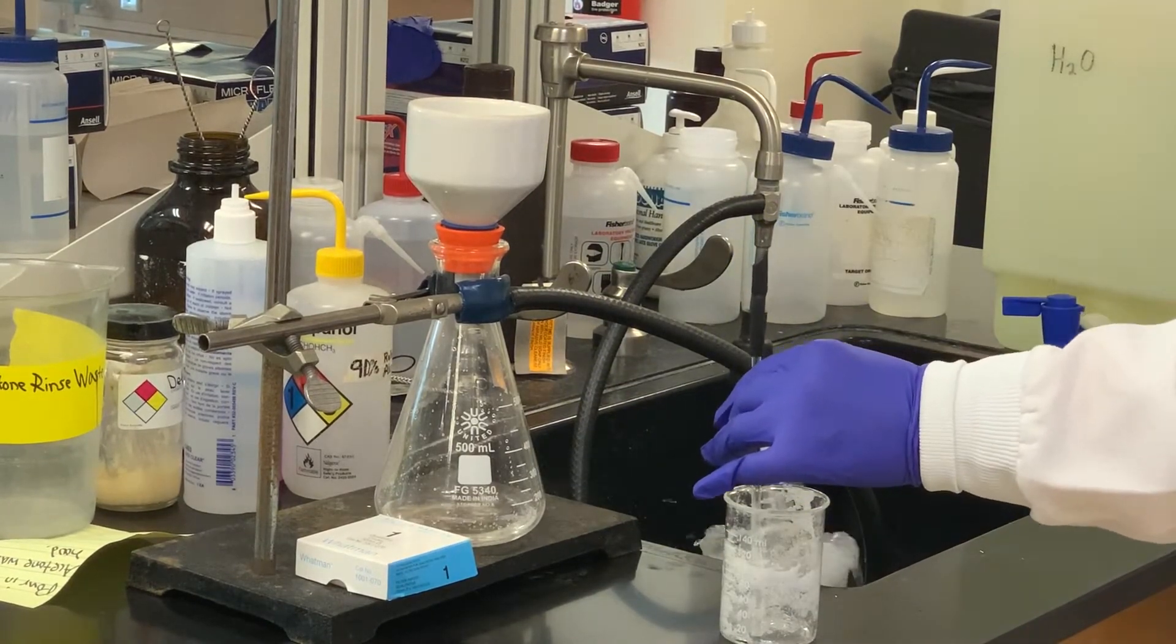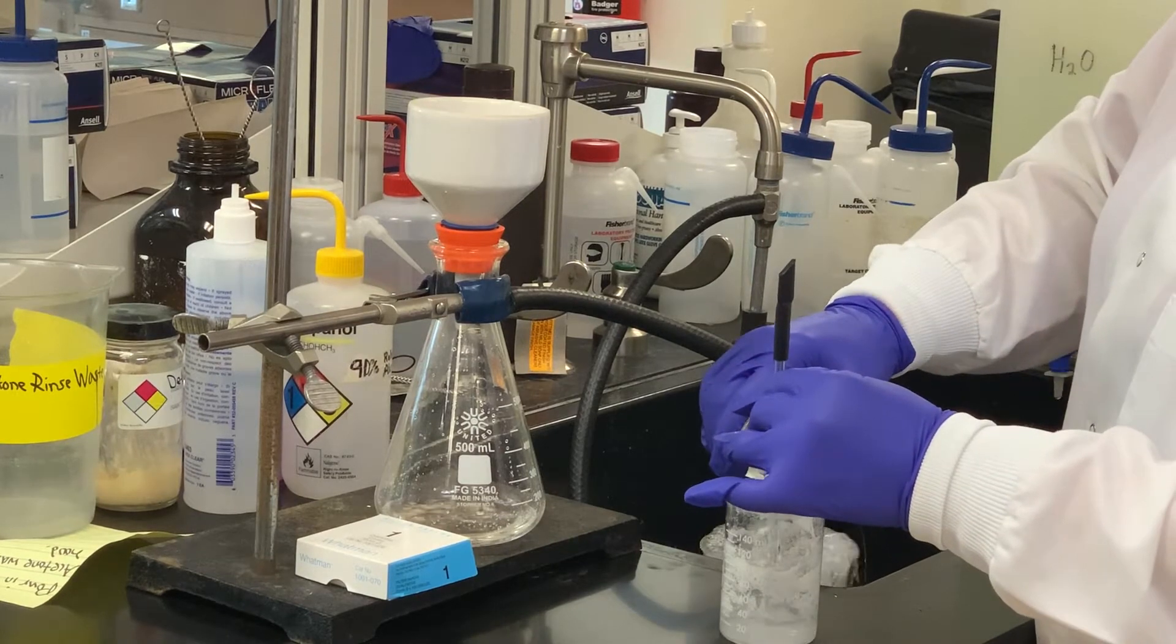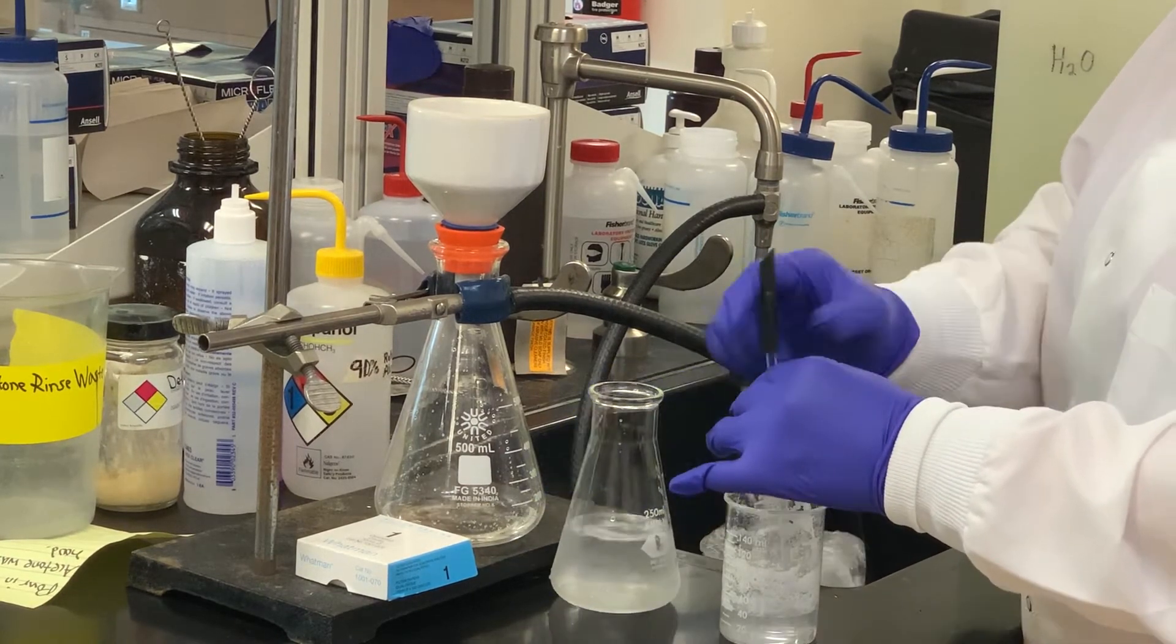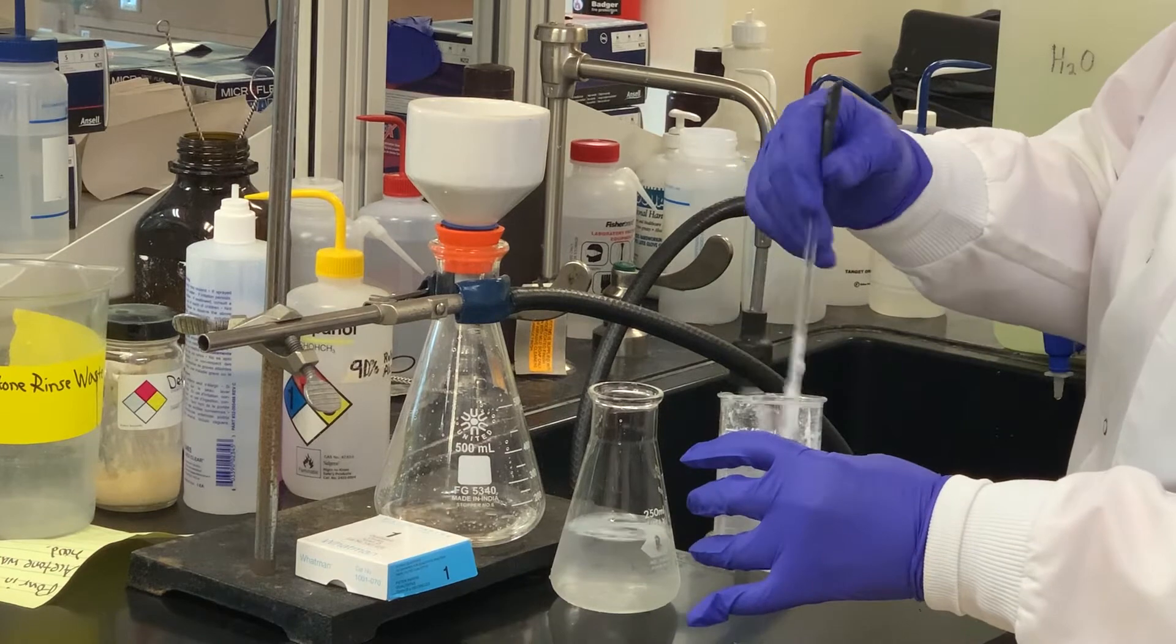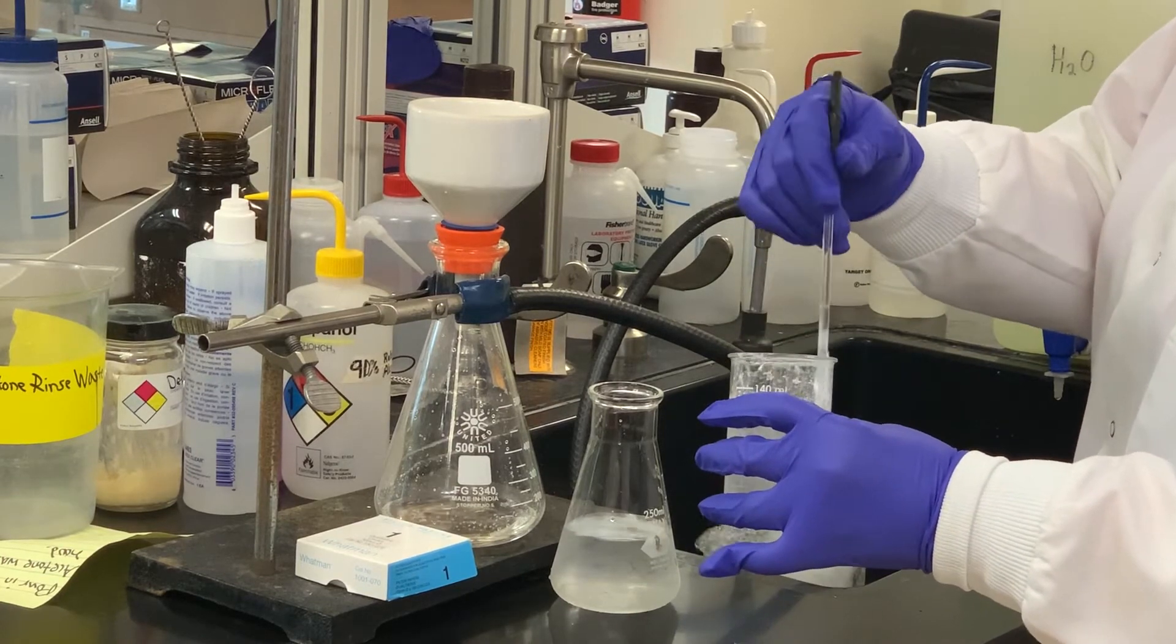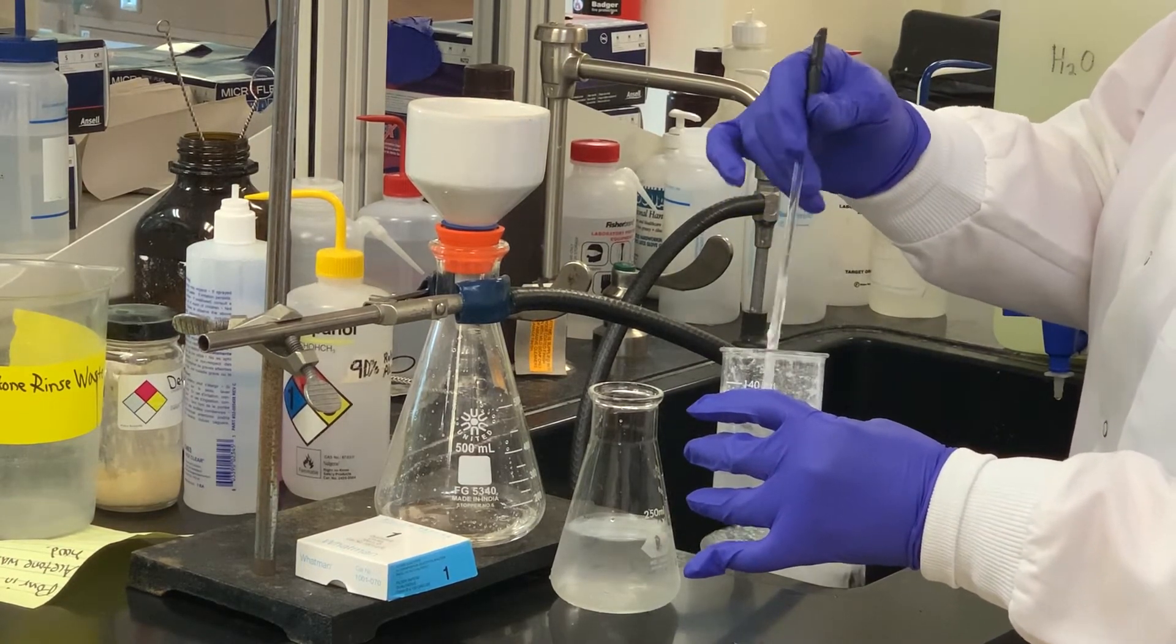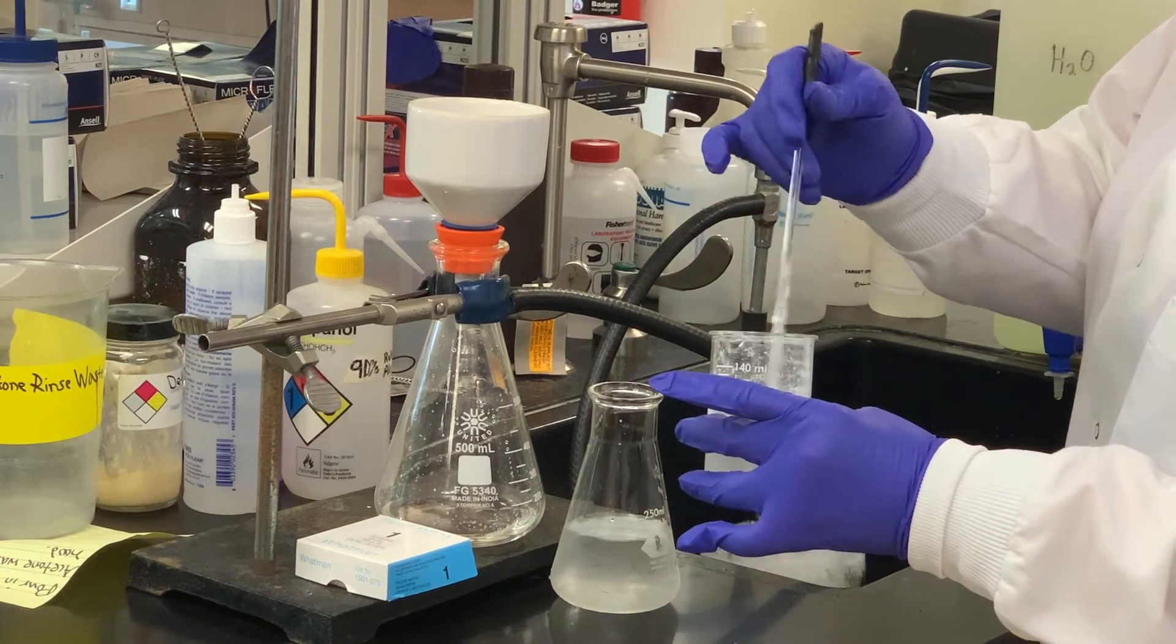I have some cold water. I'm going to rinse the contents of the beaker, try to get as much of that out as I can. Some of the solid has kind of crept up the sides of the beaker.